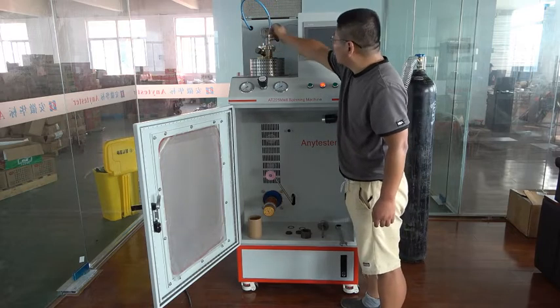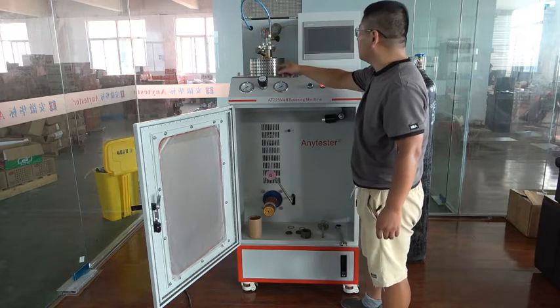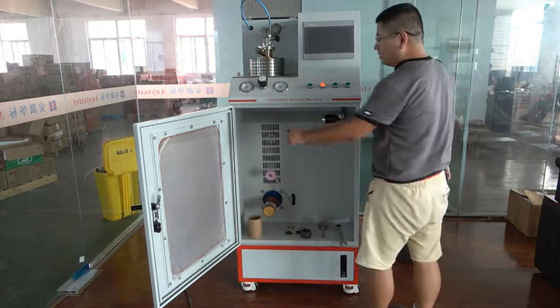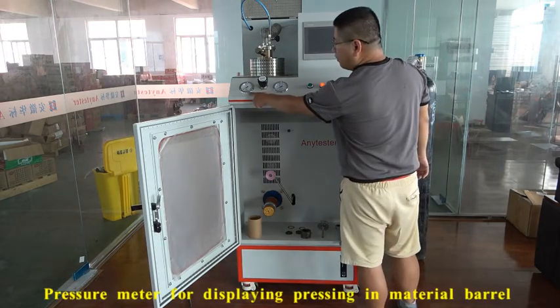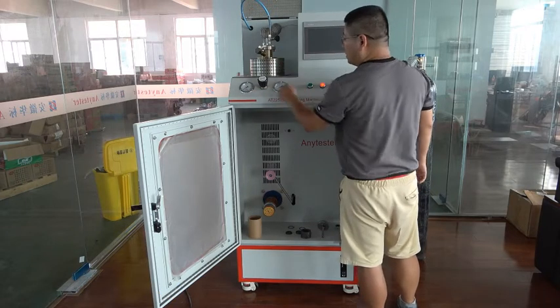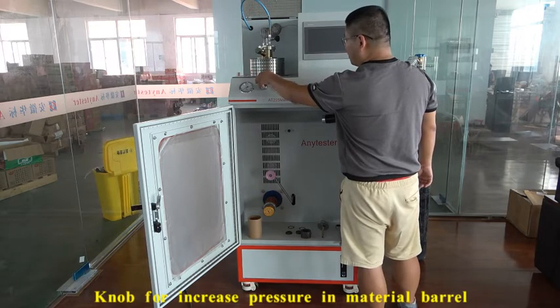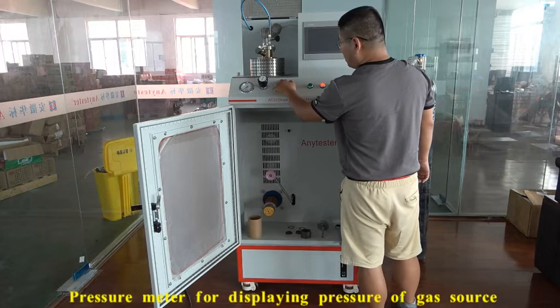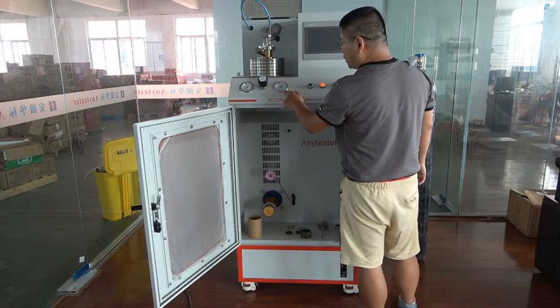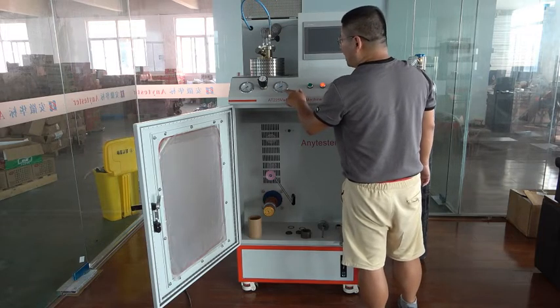This air pump is for pushing nitrogen into the material barrel to apply spinning pressure. This temperature sensor is used to measure the temperature in the barrel. This meter displays the pressure in the material barrel. This valve adjusts the pressure. This pressure meter displays the inlet pressure of nitrogen.